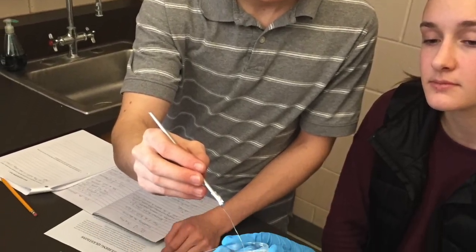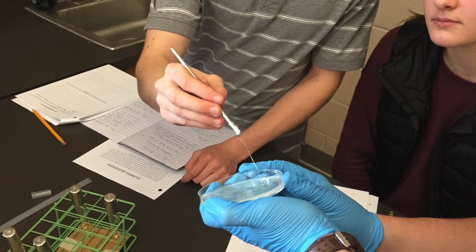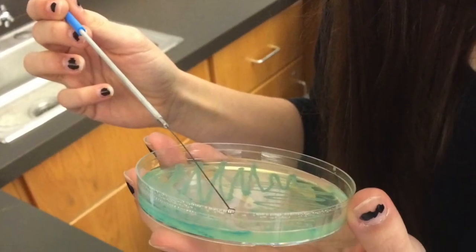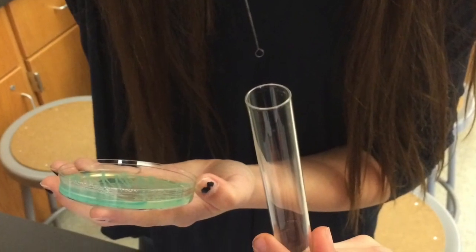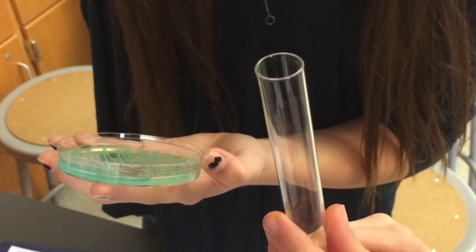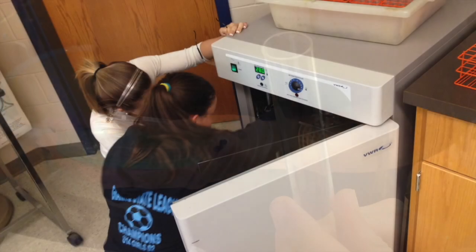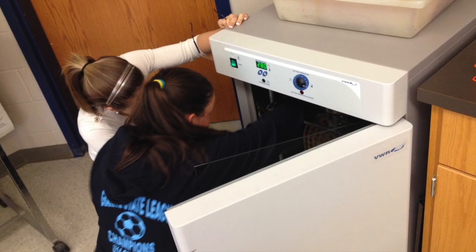In order to begin this program with the students, your teacher instructs you to place an inoculating loop in the lit flame of the burner, wait until it turns red-hot, and then touch it to the agar in the petri dish, listening for a sizzle. Then you touch the loop to a slimy edge of a colony and quickly swirl the loop in the media tube. You place the tube in the incubator and wait until the next day.